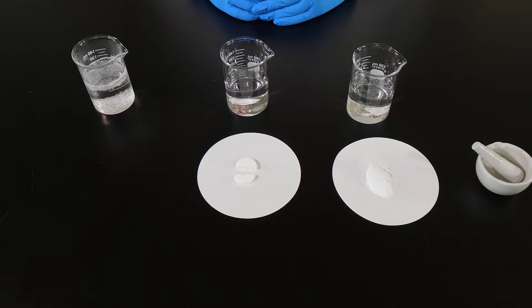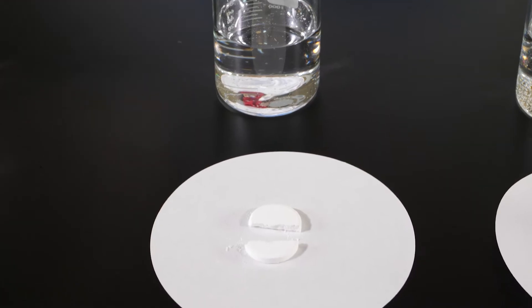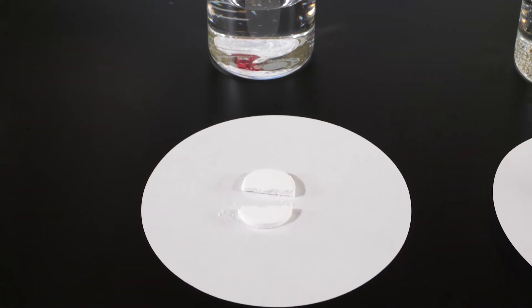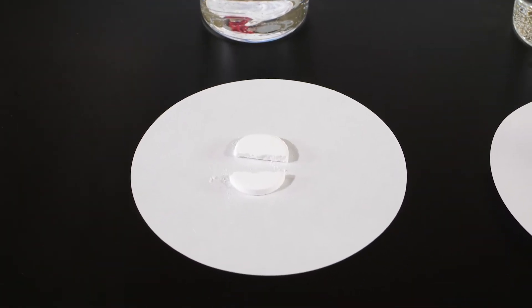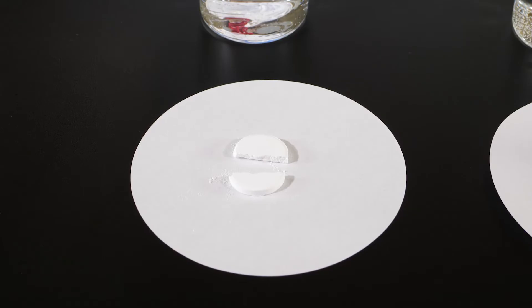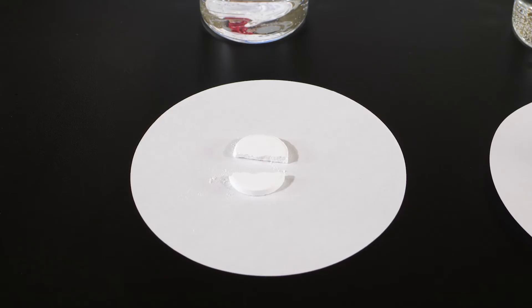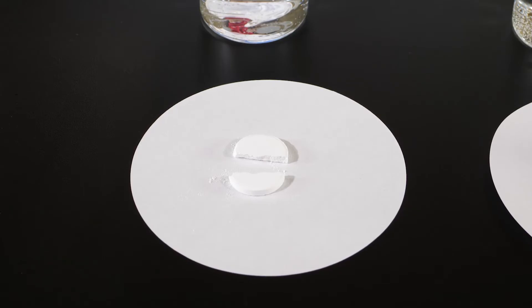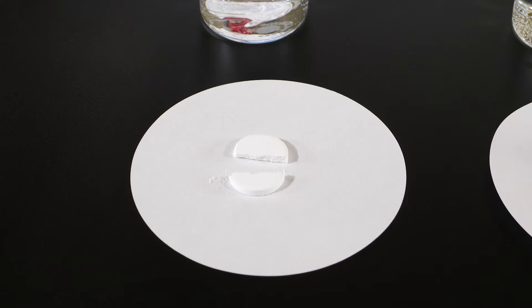For our next test, an effervescent tablet has been broken into two pieces. The tablet has the same volume as a whole tablet, but its surface area has been increased. This tablet represents food that has been slightly chewed.